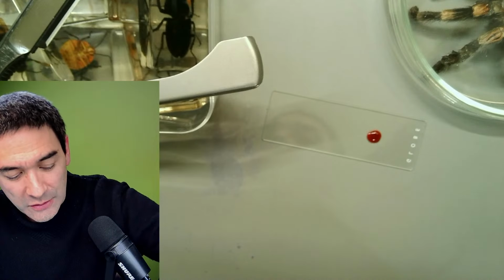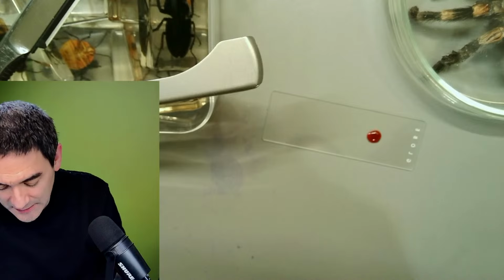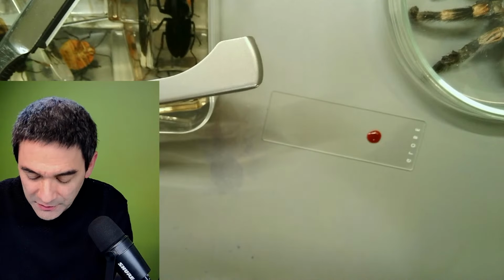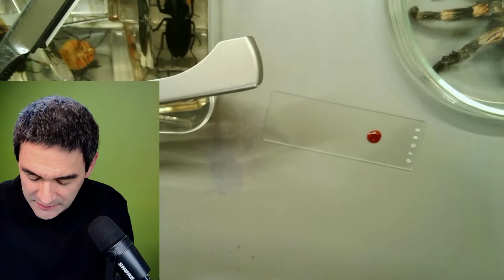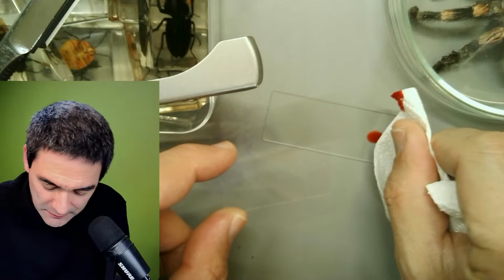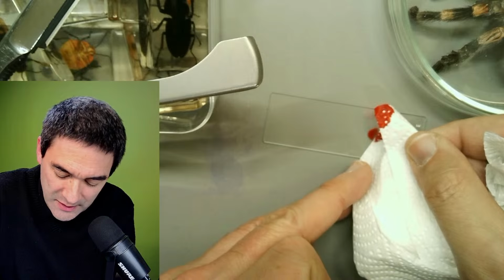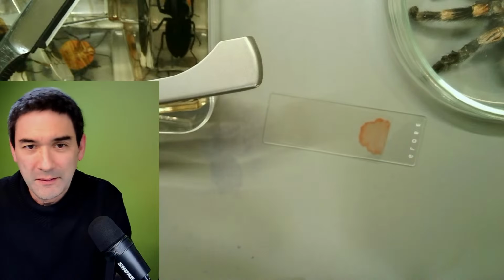If you want, we can also look at a little bit of blood later on. But then again, this is something that I've done already in the past. If you want to look at blood, you can make a little blood smear, or what you can do is the following. This is too much blood, I just realized. Let's take a little bit away. Let's make a very thin blood film. This is a little bit, I don't know. You see those, I don't know, what did Bob Ross always say? The artist, happy little accidents? Yeah? So, we can have a look at this as well.